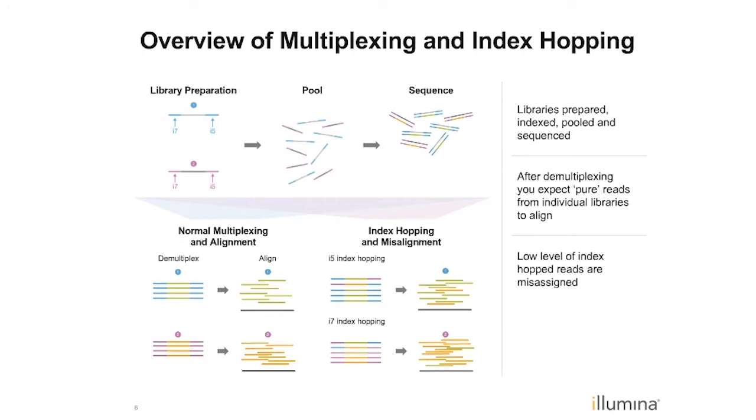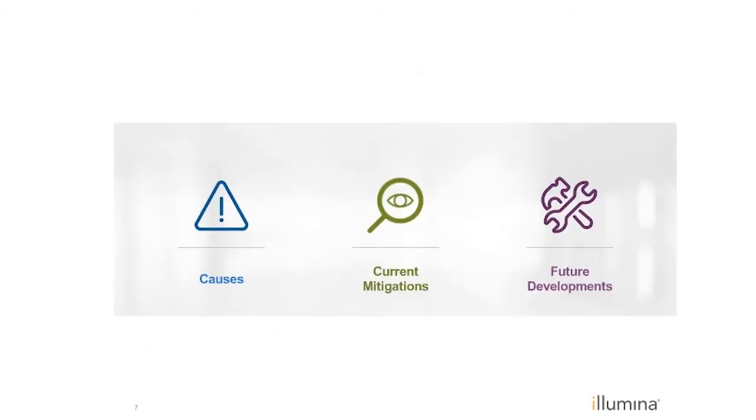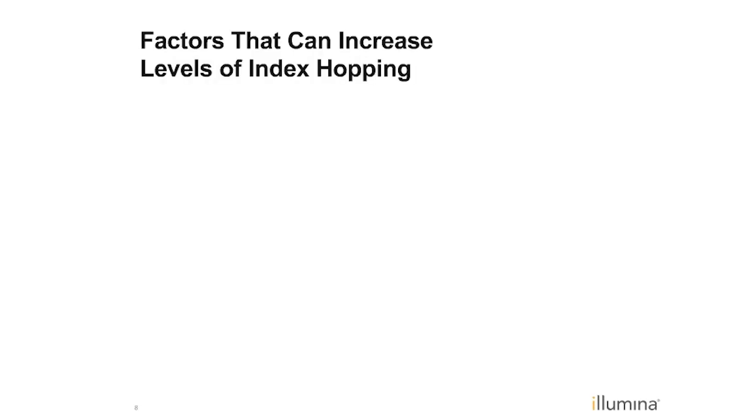But in the cases where you have a little bit of index hopping going on, some of the fragments will contain unmatched, unexpected pairs, where instead of having a blue-blue or a purple-purple, you'll get a purple and blue combination. And what that leads to is a small amount of potentially contaminating reads in your expected reads. As I'll talk about a lot during this presentation, unique dual indexing enables hop reads to be completely removed from the data, and that's one of our key mitigations for this phenomenon.